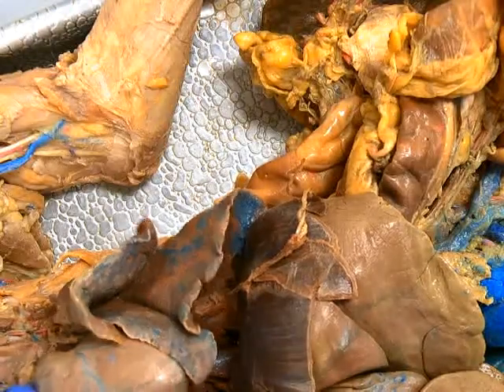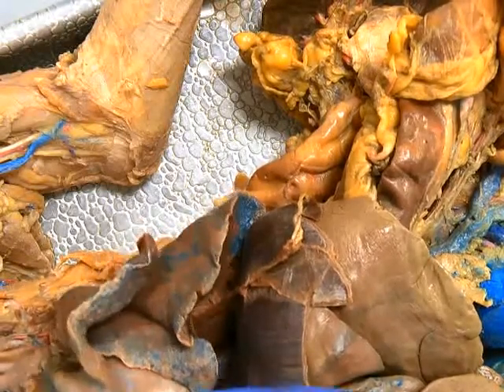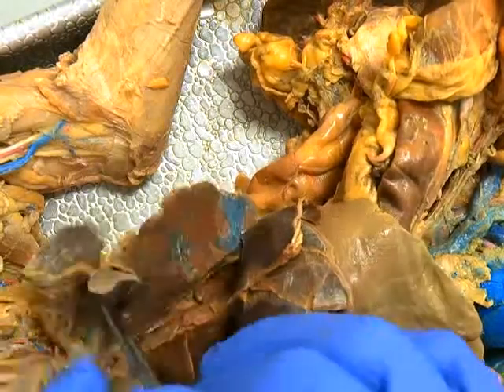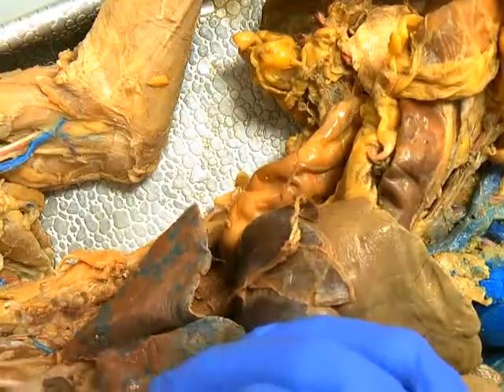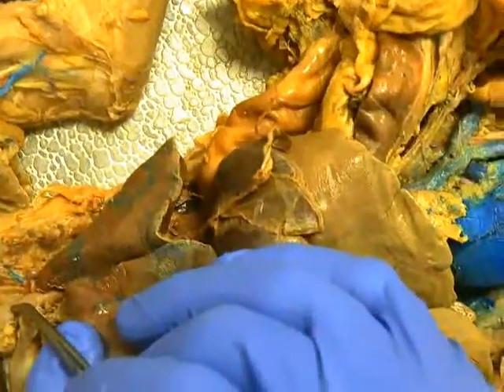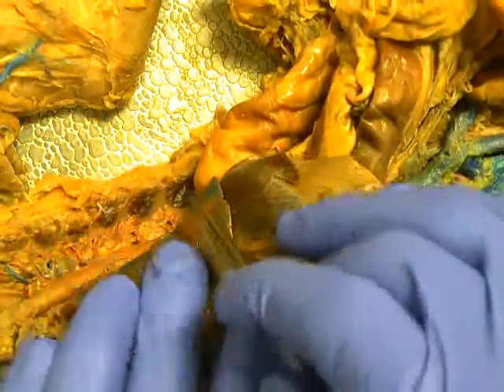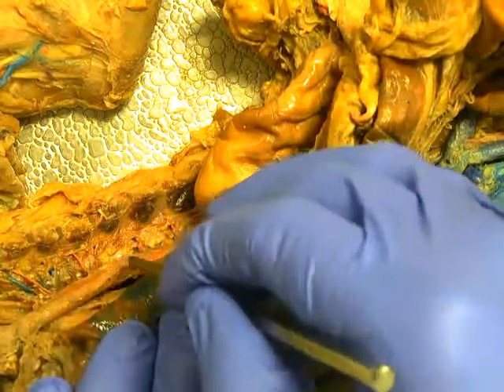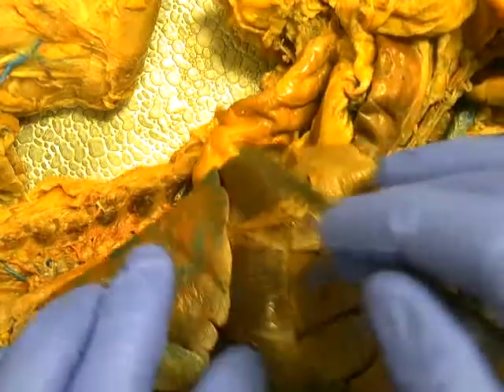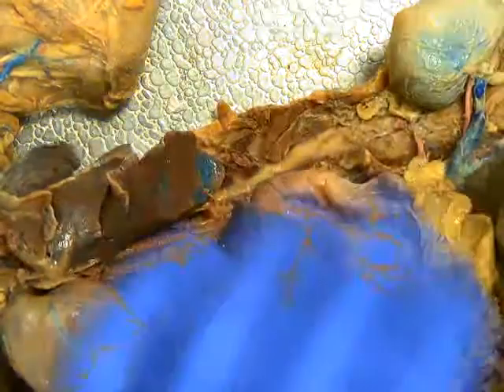We'll see the ascending aorta, aortic arch, and in a small segment, the descending aorta. If we pull up the lungs and the heart, we'll see running all the way down the thoracic aorta, and as it pierces the diaphragm, that will become the abdominal aorta.